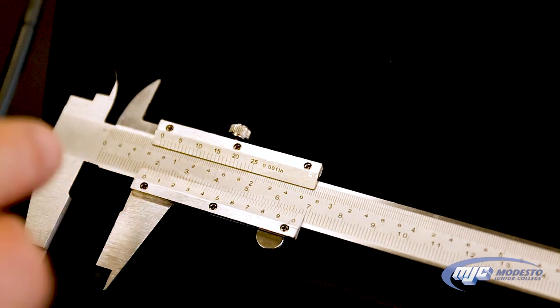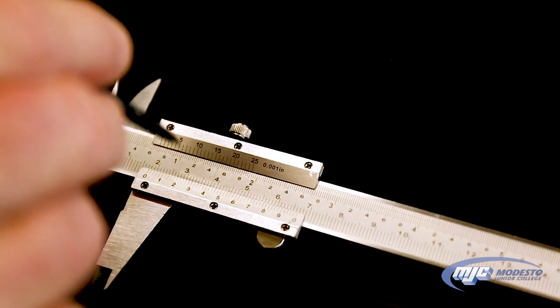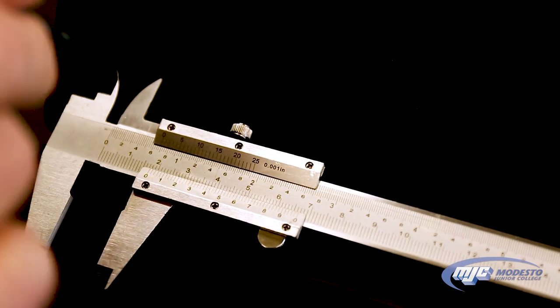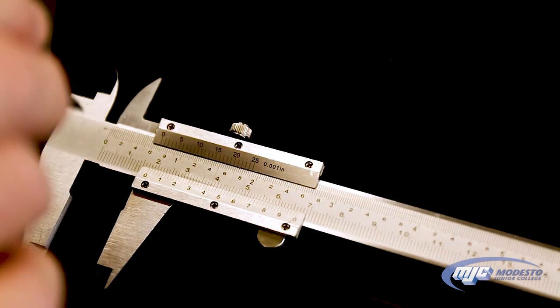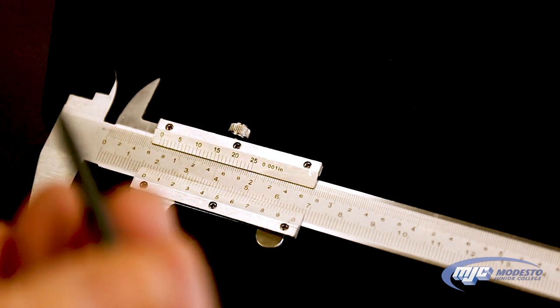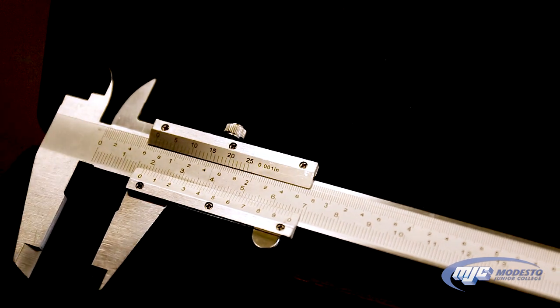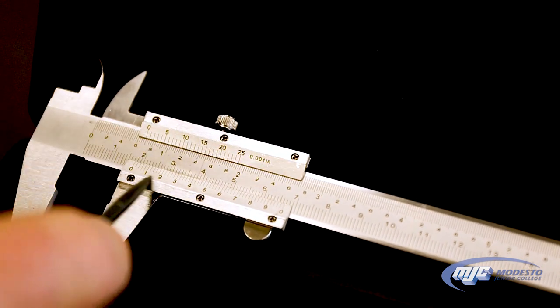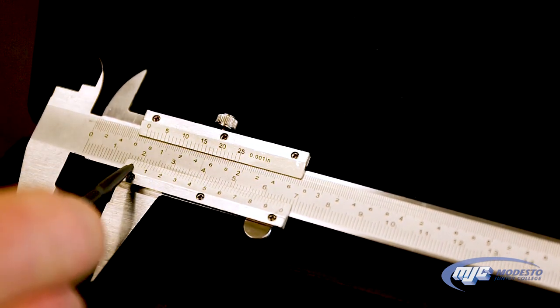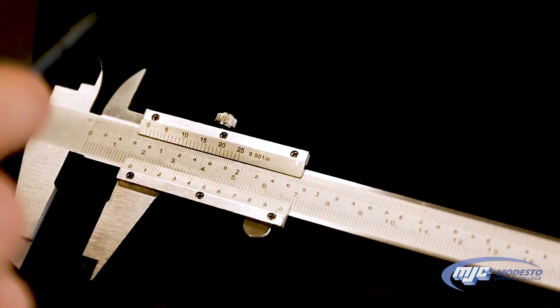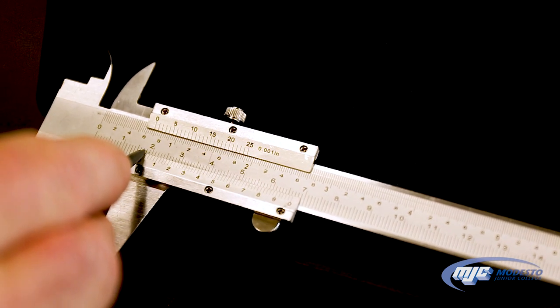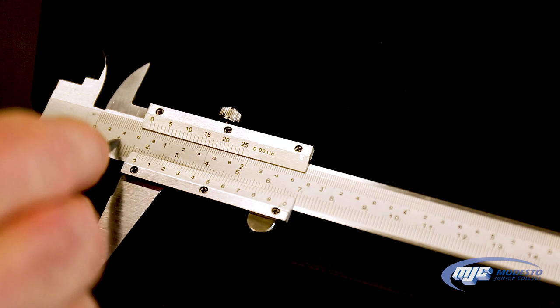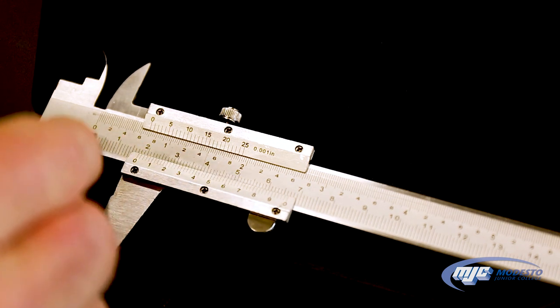The next thing is that read properly, you will take that measurement to three places past the decimal when you're measuring it in centimeters as we are. So the expo marker that we just measured, what we do is we come down to the bottom scale here and find the zero right here. That's the first thing we find and see where it is on the scale that's right above it. So this is in centimeters.